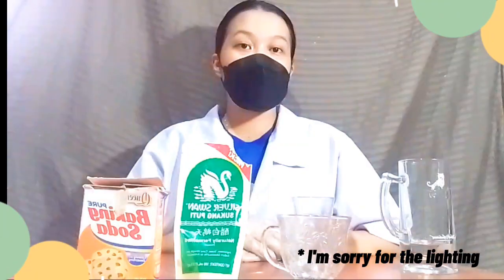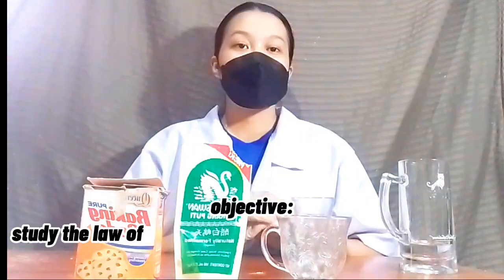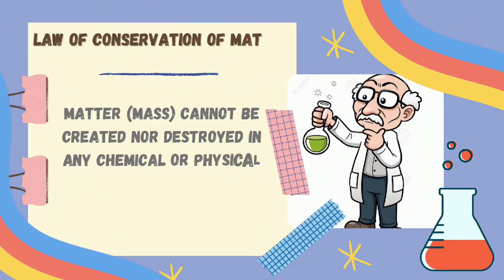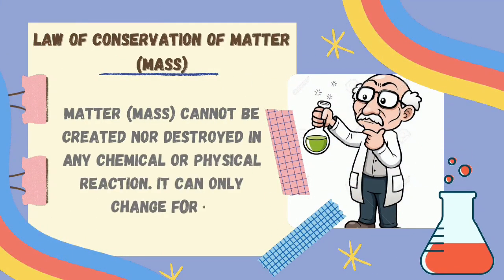Everyone! Today, we will be doing experiment number 4, which is the law of conservation of matter or mass. So the objective of our experiment is to study the law of conservation of matter in relation to mass before and after a chemical reaction. So let's get started. Always keep in mind that in any chemical or physical reaction, matter or mass cannot be created nor destroyed. It can only change form.